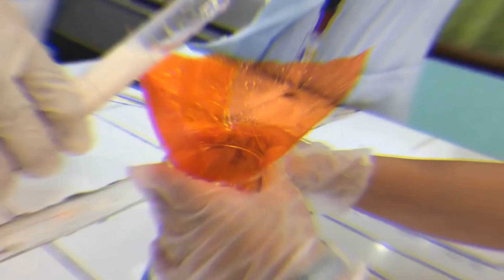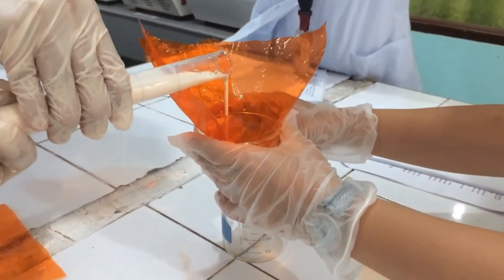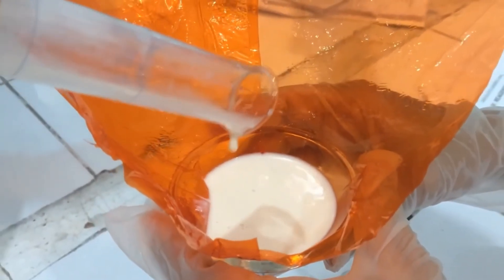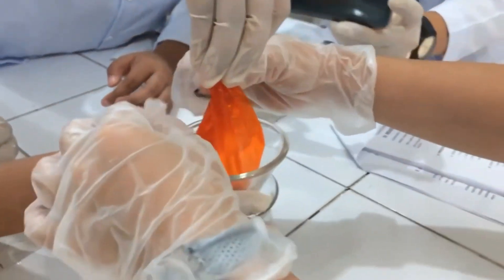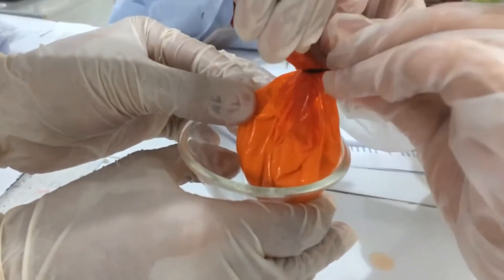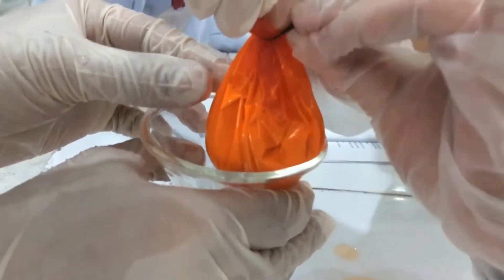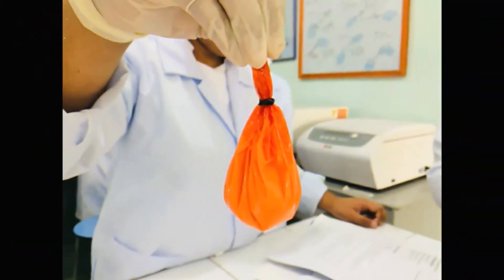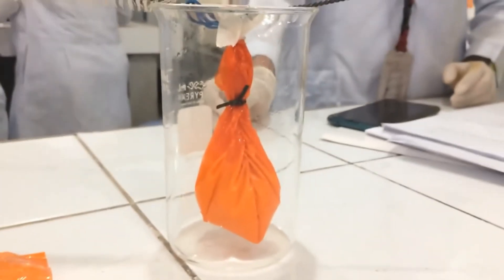Now, pour 50 ml of milk into it. Place the bag into a 500 ml beaker and suspend it so that it almost touches the bottom. Add distilled water to the beaker. Make sure that it is at an equal level with the surface of the milk.